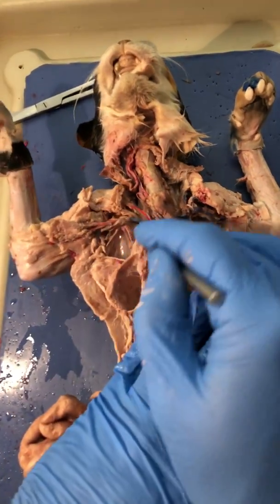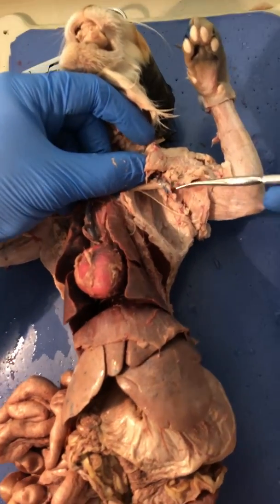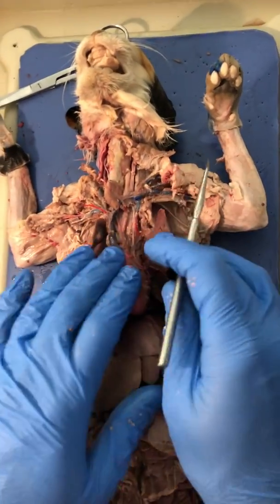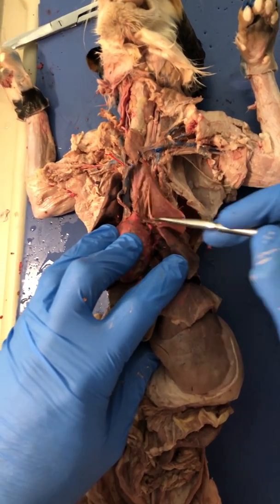And on this side, this side here, it's a little bit better. Coming down from the bottom, this would be the long thoracic flowing down. Those are the veins. The arteries, we have the pulmonary trunk is in this mess down here.